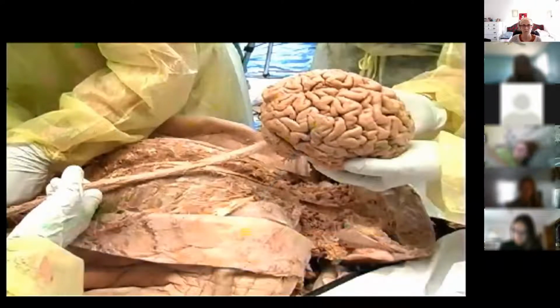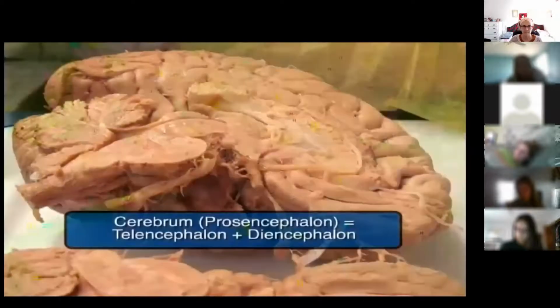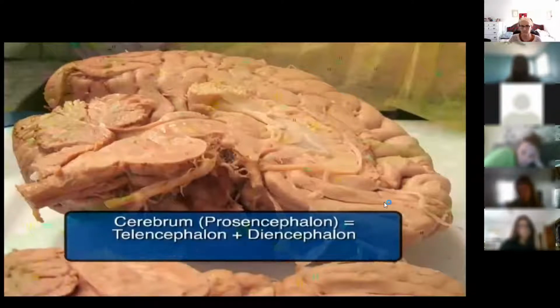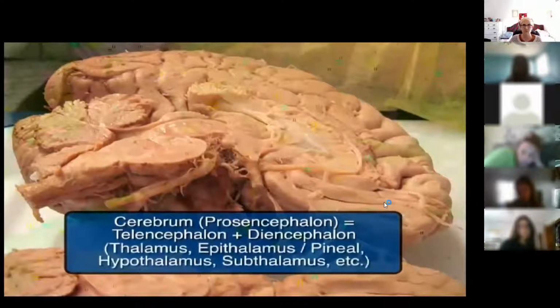We are now going to describe some basic brain parts using some Latin words that may seem difficult. These names came from the primary brain vesicles formed in the embryo in the first 5 weeks of pregnancy. The cerebrum, in Latin prosencephalon, is itself divided into the telencephalon, the major mass of the cortex, and the diencephalon, which includes all the parts you can see on the screen. We will go over these parts in more detail later on.